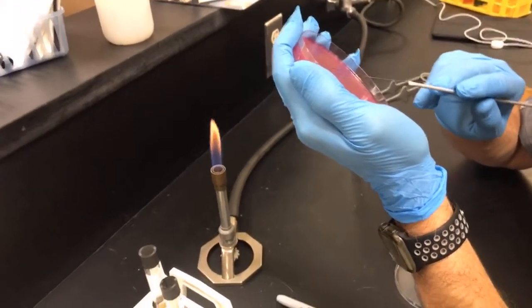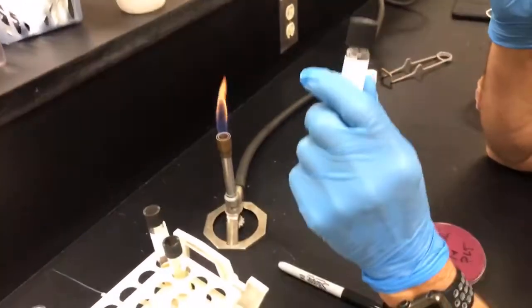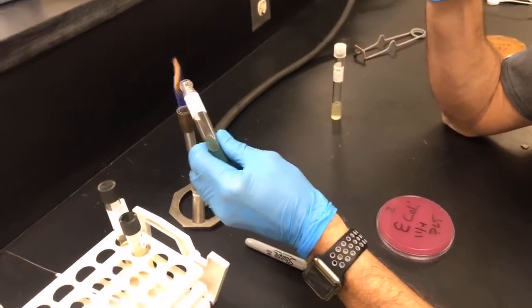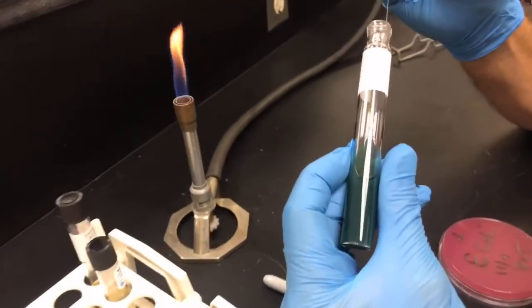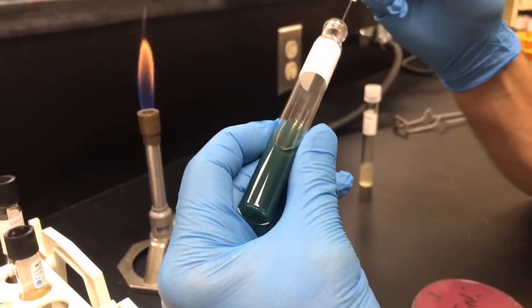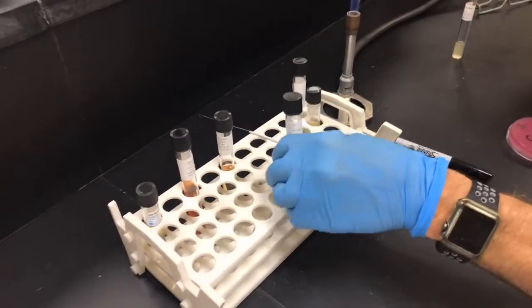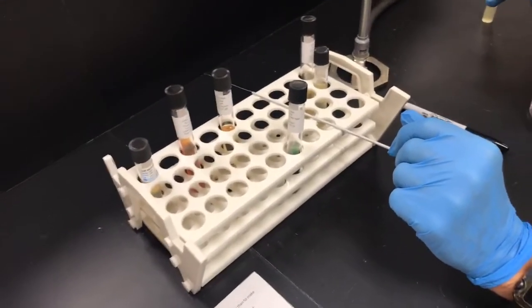The reason for this is that using the inoculating needle will reduce the number of microbes we're transferring, and sometimes if you have too many microbes and they're dying, you can get a false positive result, which we don't want. So he's going in and just doing a regular streak up that slant. So those are the biochemical tests that we're using for the Enterobacteriaceae lab. We'll do those for all of our unknowns and then analyze the results when they're done.